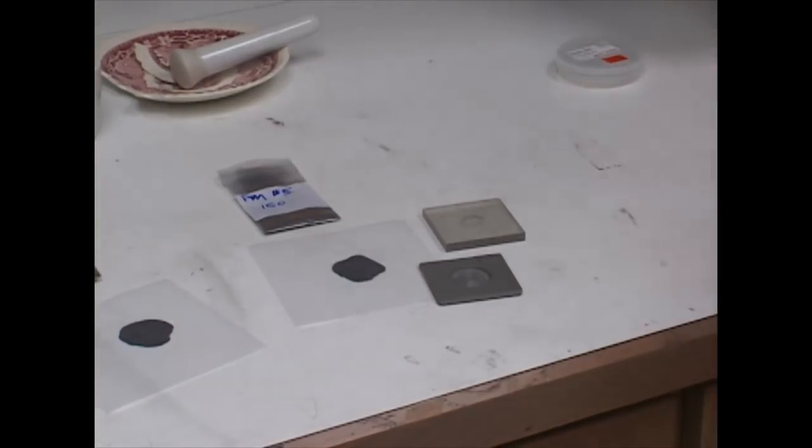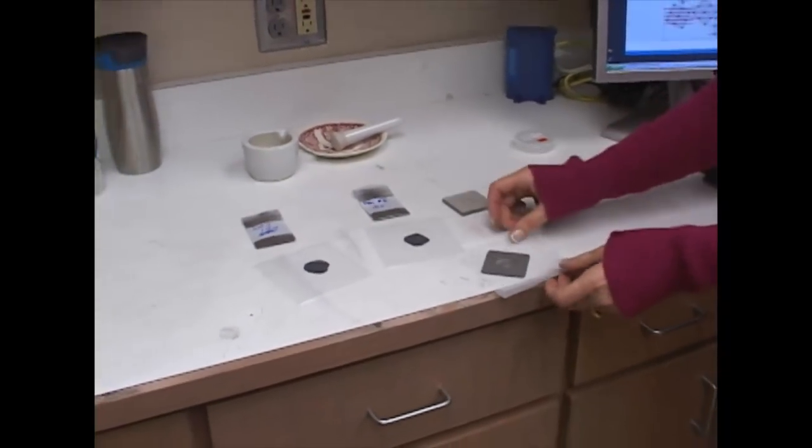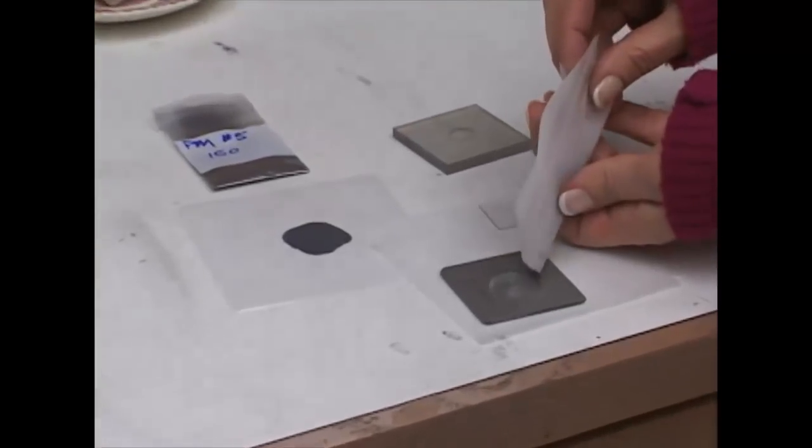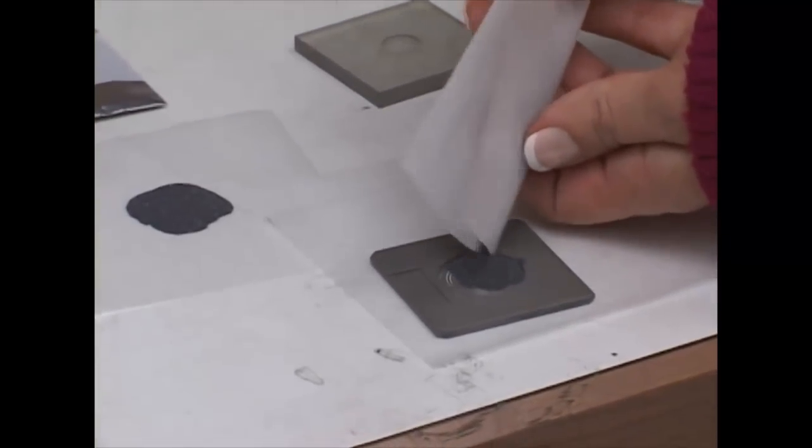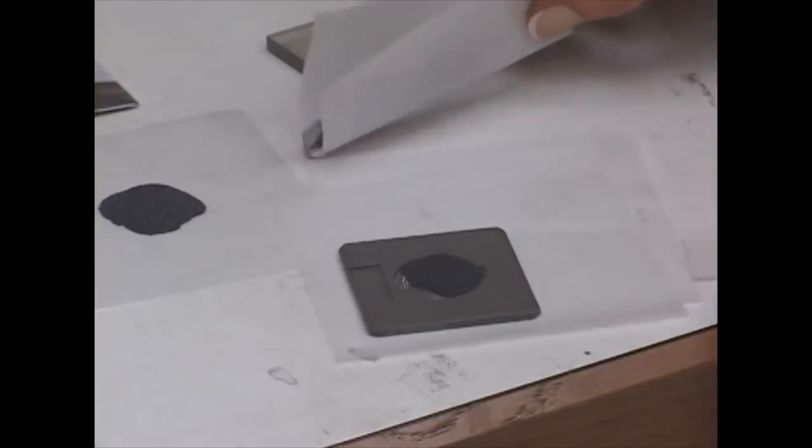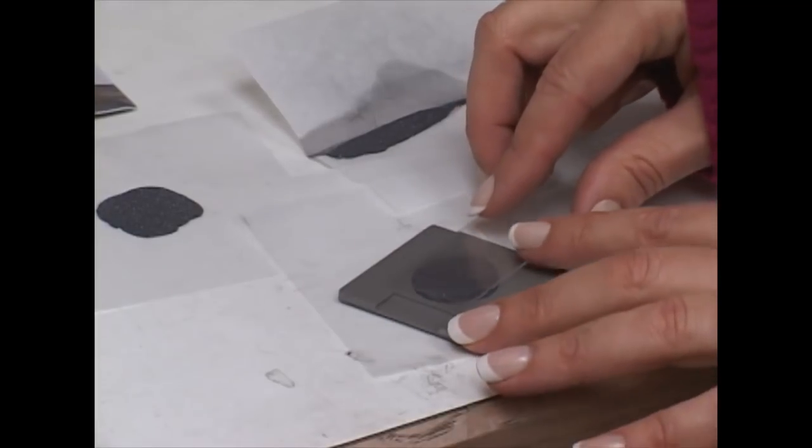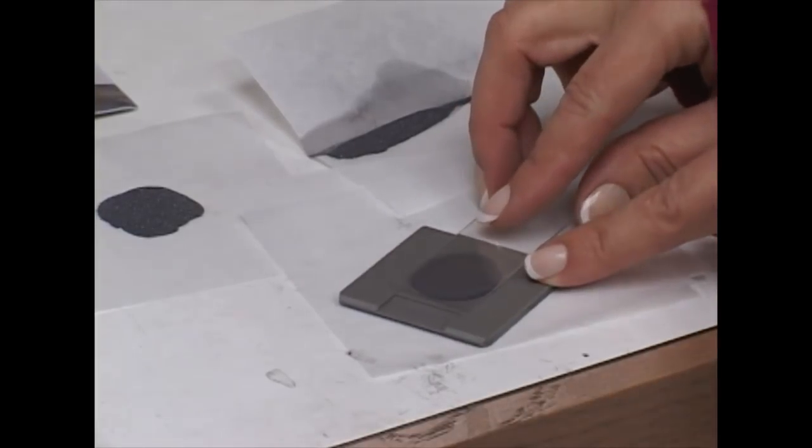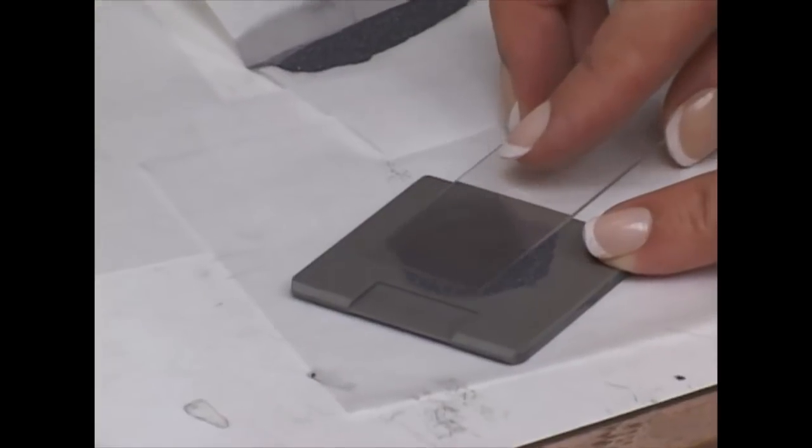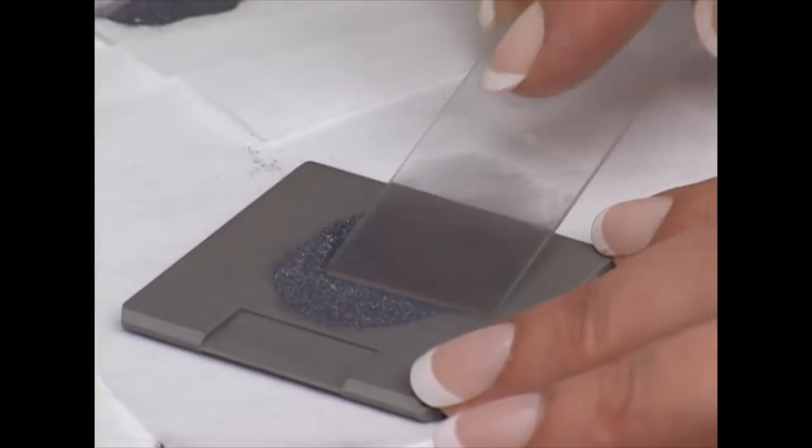We have sample holders in here in the lab and once your sample has been prepared properly, you are welcome to come in and use our sample holders. We ask that you please clean up after you are finished and that they should never leave the lab. Place your sample in the well and just kind of estimate how much you are going to need. You are going to be pressing it down and you want to make sure that it is filling the well but is still flat with the surface of the sample holder and you just gently scrape off whatever comes out of the well.